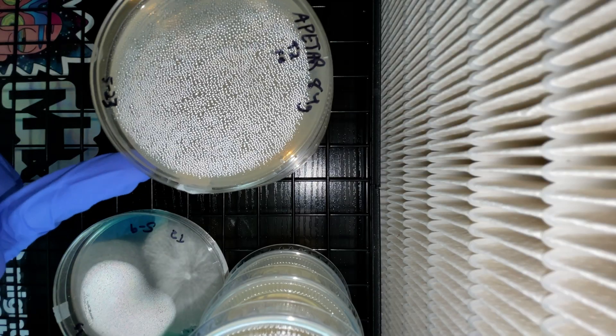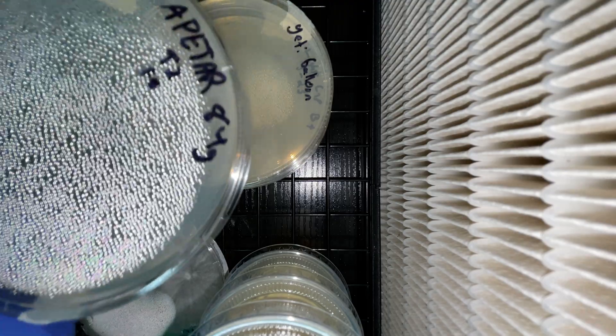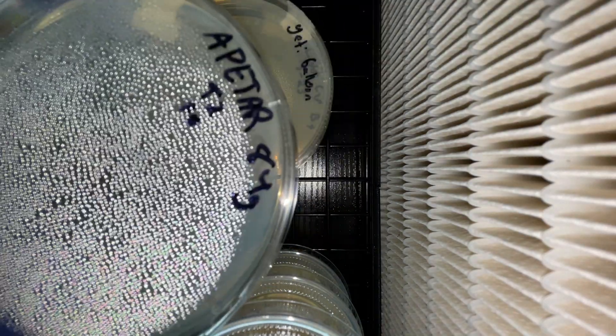And like always, make sure you label it properly and tape your edges. Can't go wrong there.